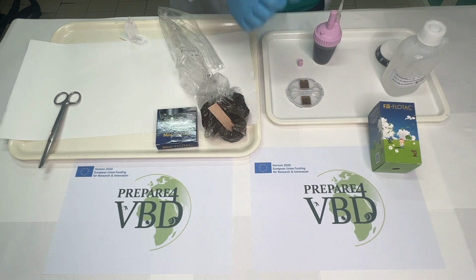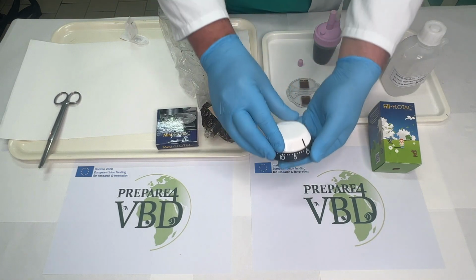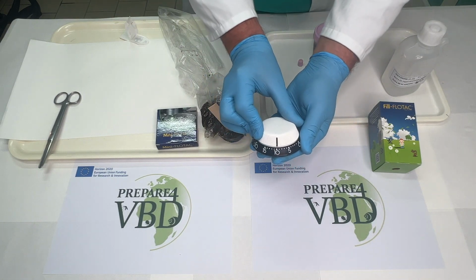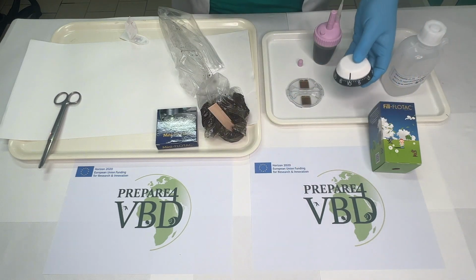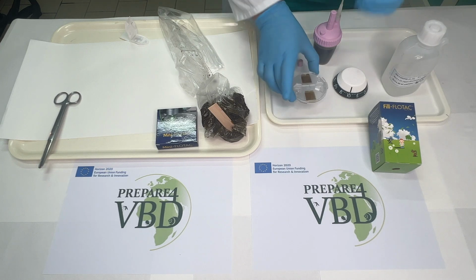Then the last step will be to wait 10 minutes. But for the sake of time, today we already prepared another mini-FLOTAC, so we will not wait 10 minutes. And go ahead, Antonio, you will translate now.